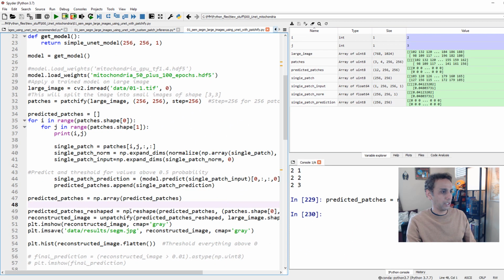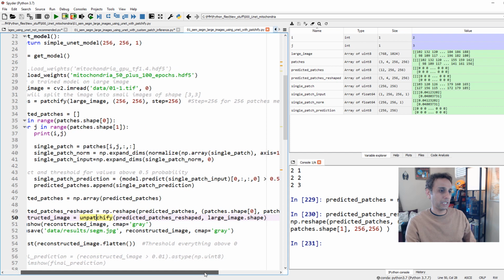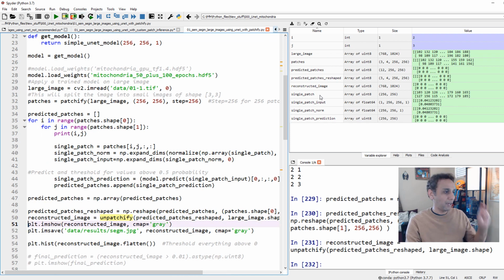So that's what we are doing here, numpy.reshape. And you should see 3 by 4 by 256 by 256, my predicted patches reshaped. So now I have my reshaped patches in the same order as my original patches. So now I can unpatchify. That's the next step, okay? Unpatchify my predicted patches to what shape? To the same shape as my large image, which is 768 by 1024. So when we do that, it should unpatchify it. Reconstructed image is 768 by 1024.